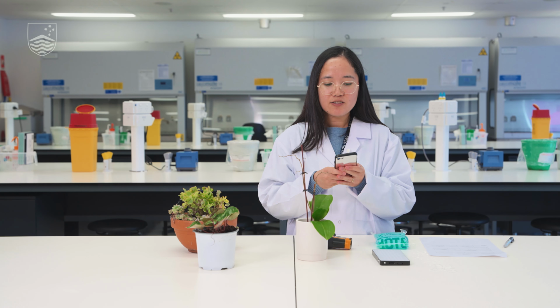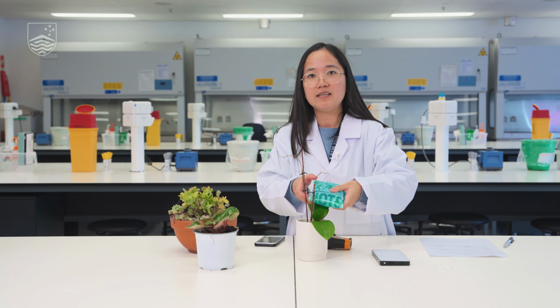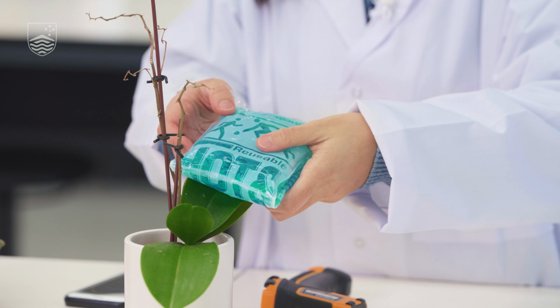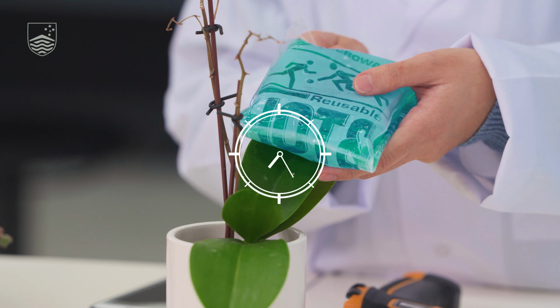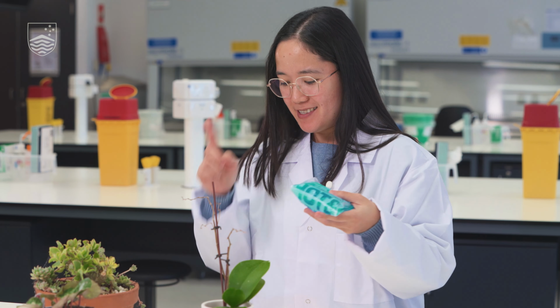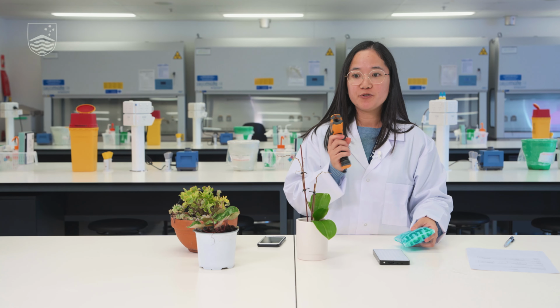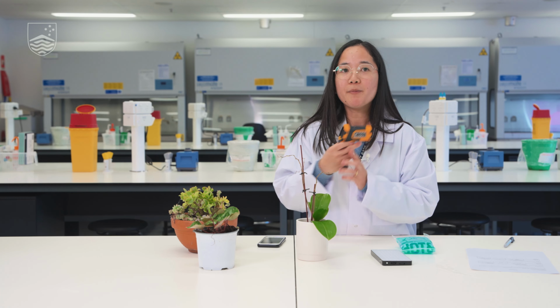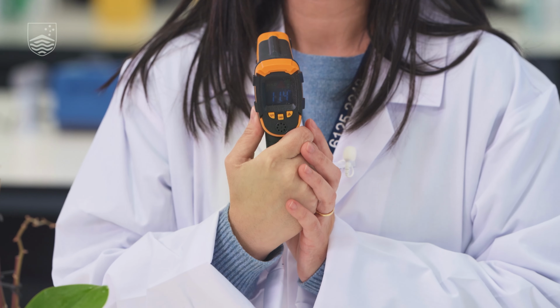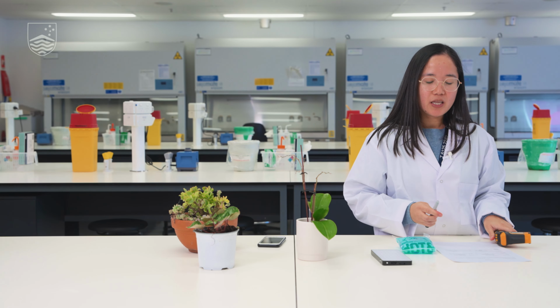So again, let's set up our timer for a 5-minute treatment. We just need to put the leaf directly in contact with the ice pack and time that for 5 minutes and see what will happen. All right, so the 5 minutes is up. The timer is now sounding off. Now we will do the measurement again. For this particular leaf, our measurement is at 11.4. Yep, so again, we will record that value in our table.